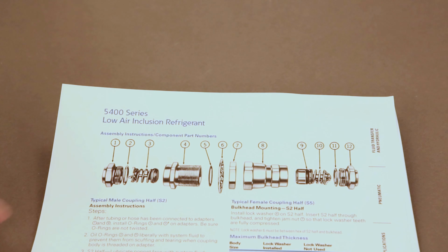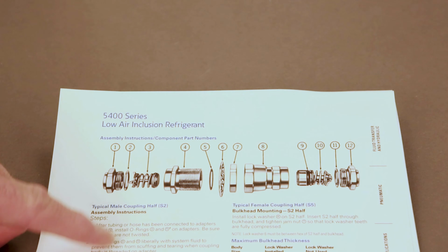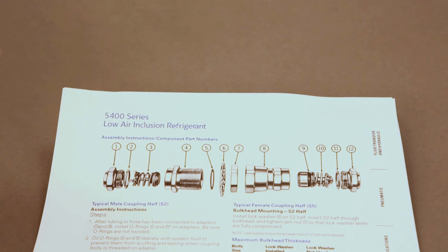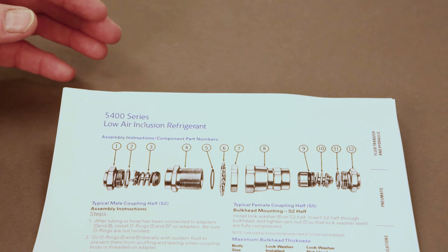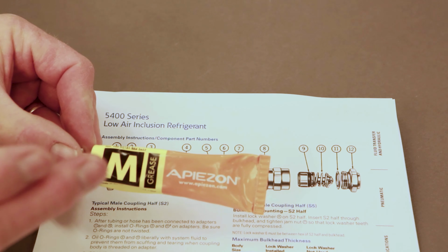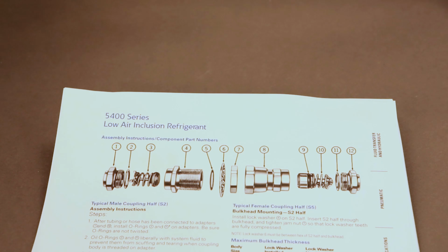There will be no mention in here of using the Loctite. There is in here a reference to lubricate various components with the lubricant that is part of the refrigeration system under service. That's really not possible to do with the CryoTiger systems, so that is why I instead suggested using a vacuum grease, and then after vacuum grease is applied, use the clean room wipe to wipe off as much as possible so that only a very small amount of the lubricant on the surface is remaining.